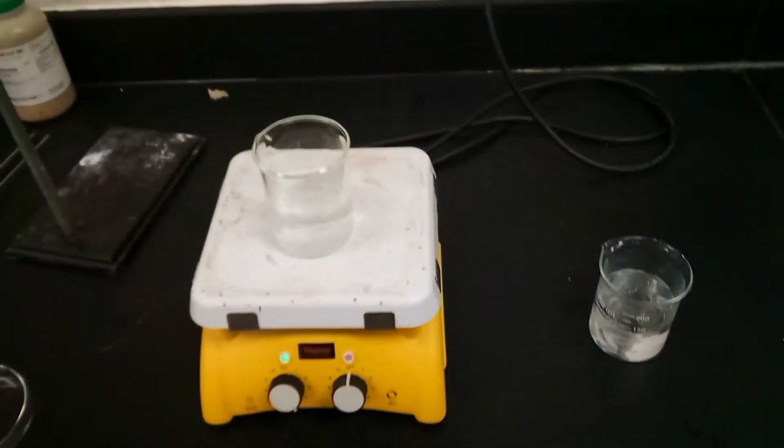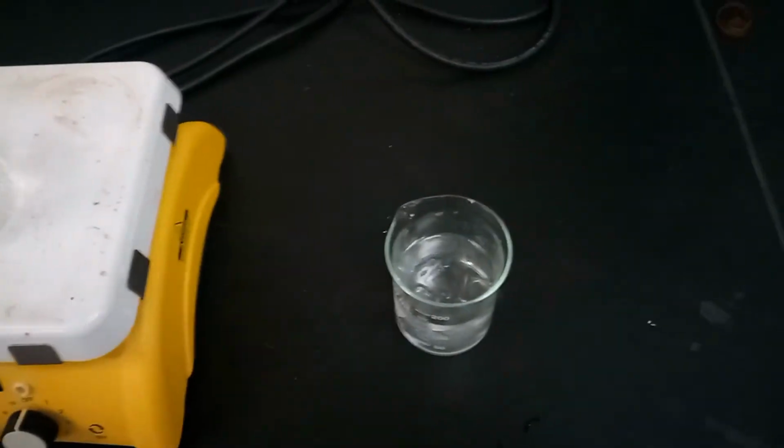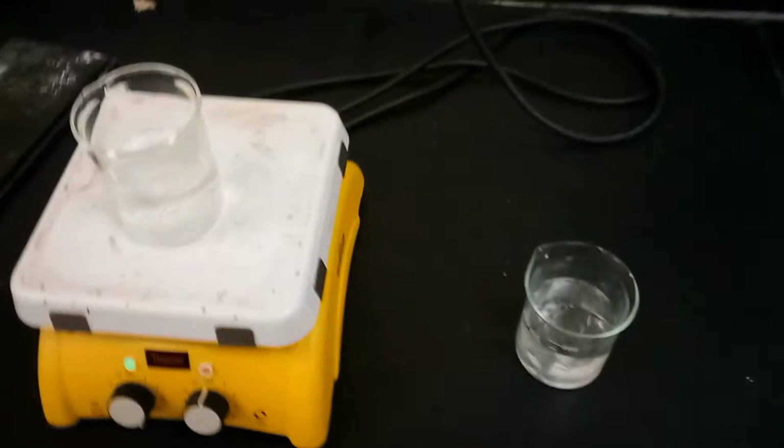So this is the introductory activity for the Le Chatelier's principle that we've been working on in class the last few days about equilibrium. The first thing you need to do is get these two beakers. The one on the left is some hot water on a hot plate, and the one on the right is some cold water with some ice in it. We'll need those later for part B, but you need to warm them up first.